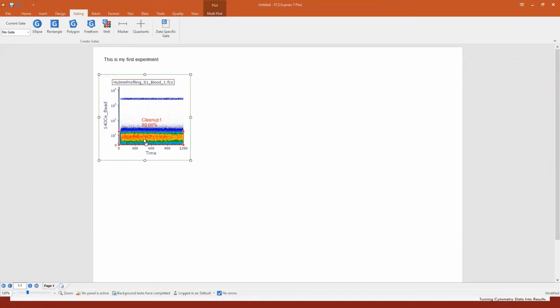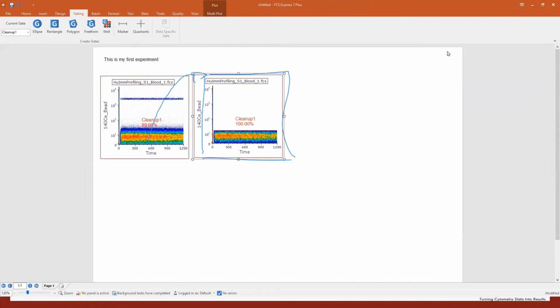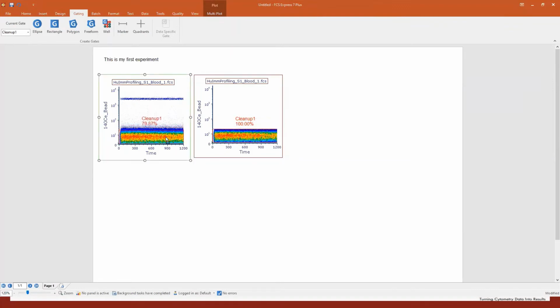So it's very easy. Use drag and drop. What I'm going to do now is dragging and dropping this gate out and releasing it here. And we will create a new plot. So, drag and drop. Here we go. We have a brand new plot, which is an exact replica of the first one, but it's gated. And you see that in FCS Express, everything is live updating. It's super, super, super fast. So plot 2 is identical to plot 1, same size, same aesthetics, but it's gated.